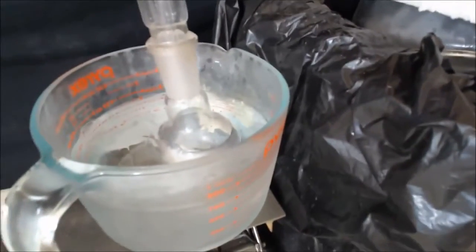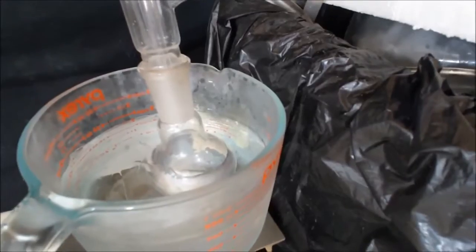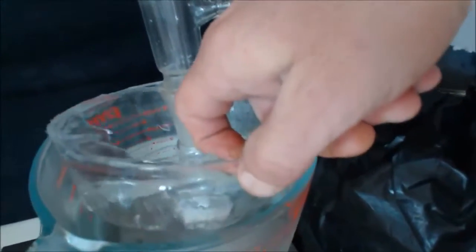I got the receiving flask. See how it's got ice in there. That little puddle right before the condenser, you can see it right there. That's my entire yield. That's it, those couple milliliters.